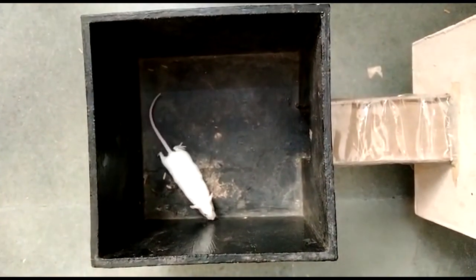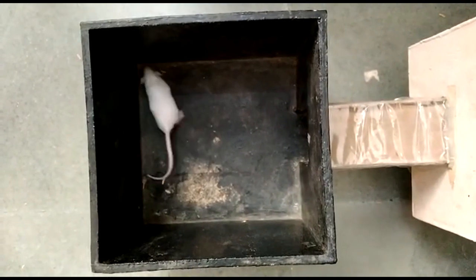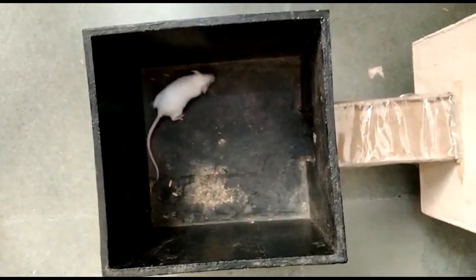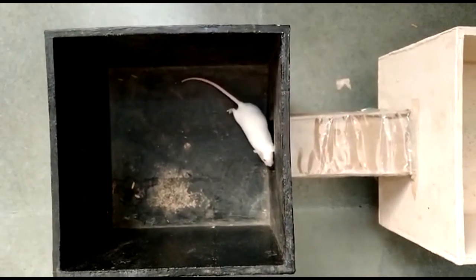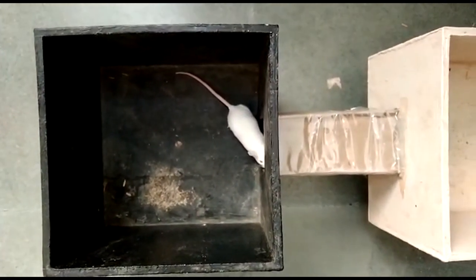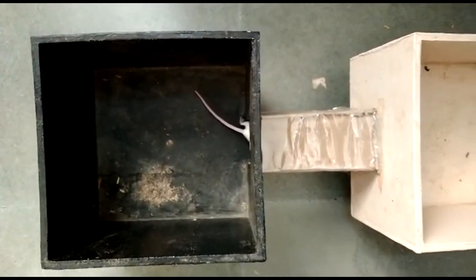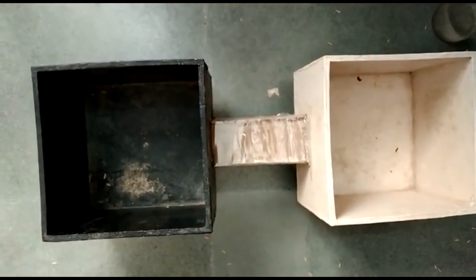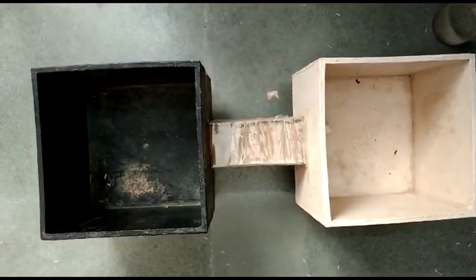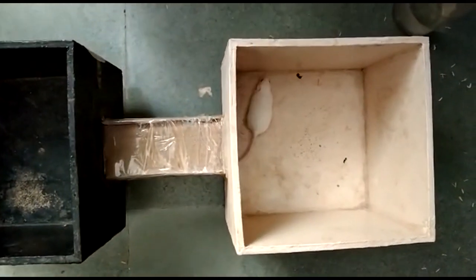A normal rodent will spend more time in the dark compartment. You can observe the time spent in the light compartment, dark compartment, and the number of entries.